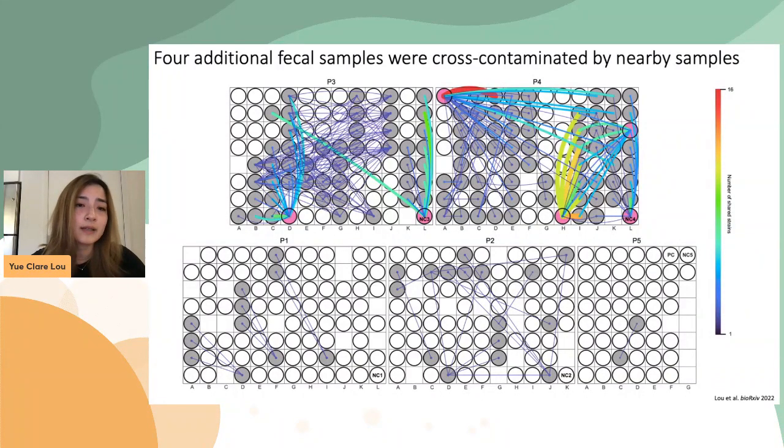And I want you to pay attention to these circles that are colored pink. These are the samples that displayed location-based and/or plate-based strain sharing patterns. This sample right here is not sharing any strains with any other samples that were extracted from the other 4 plates. However, it is sharing strains with at least half of the samples on this P4, suggesting that there might be some plate-wide spillover event happening to this sample.